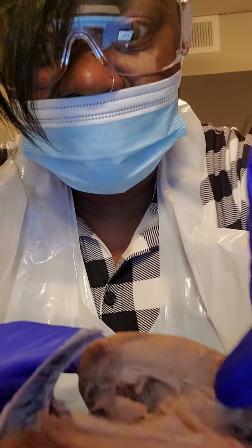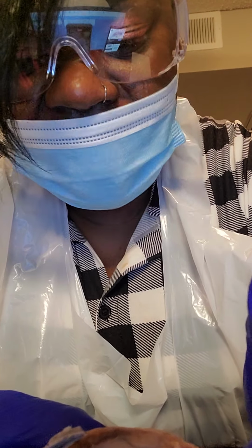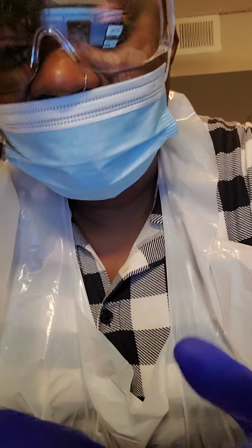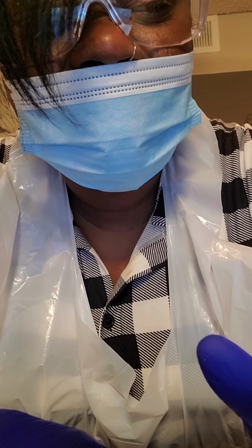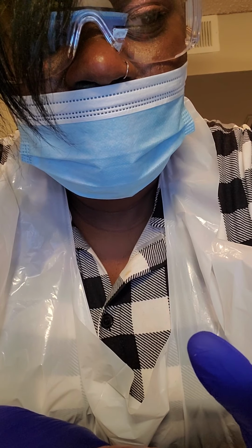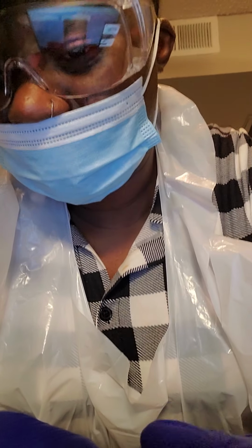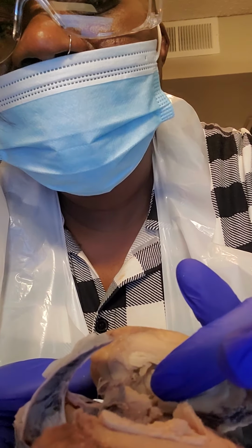Oh, it's burning my eyes. And then with that is the olfactory nerve. And the pineal gland is, the pineal gland is right here.